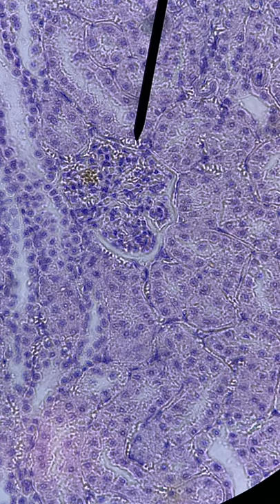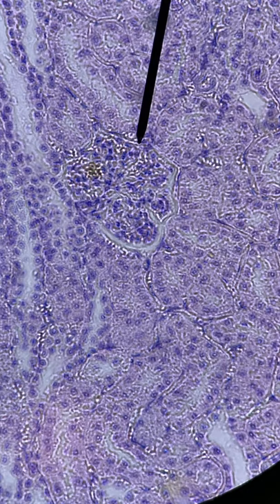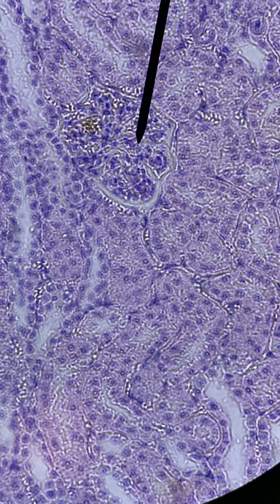What I can see is around the perimeter of this little circular object is the glomerular capsule. There is a faint whitish line that I'm pointing at right now, which is the capsular space. All of this stuff in here is the glomerulus — that ball of capillaries. This magnification is able to view that really well.